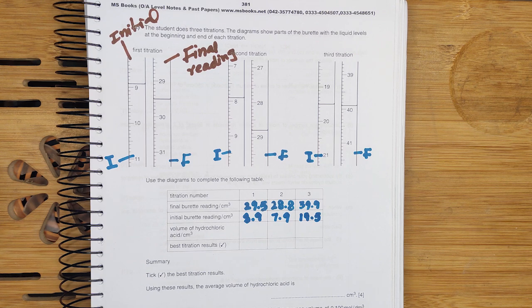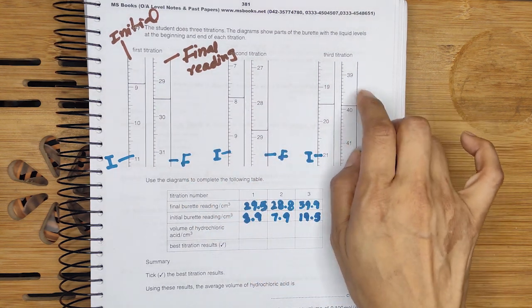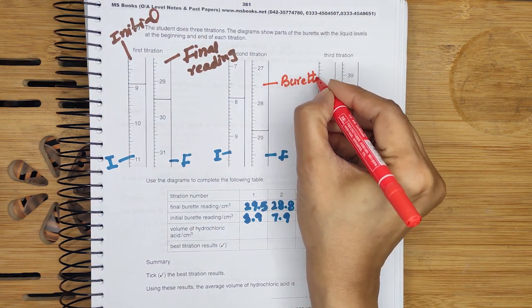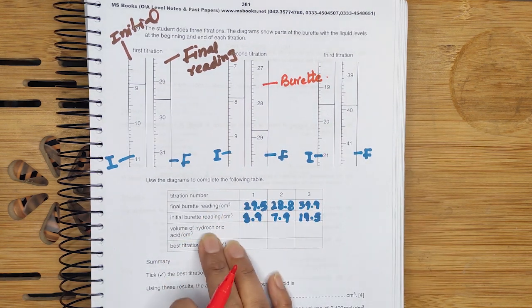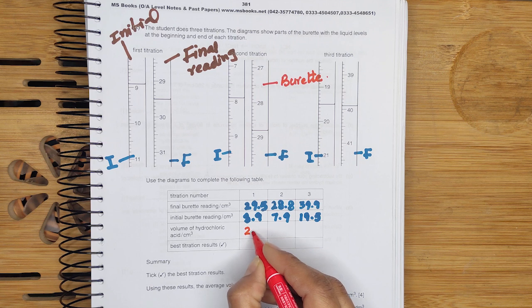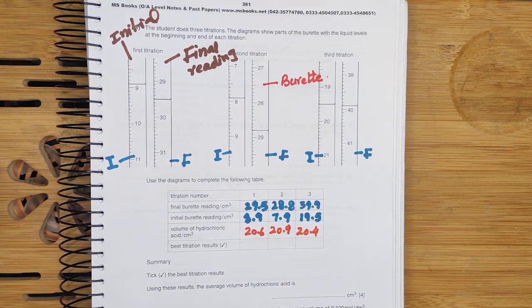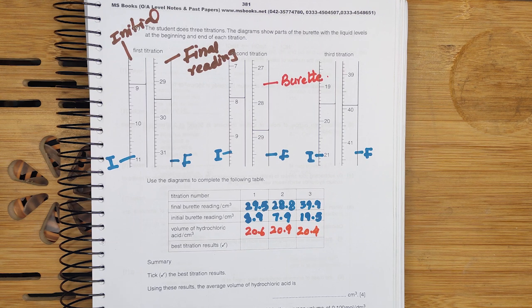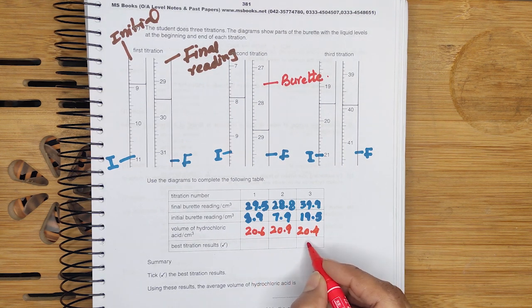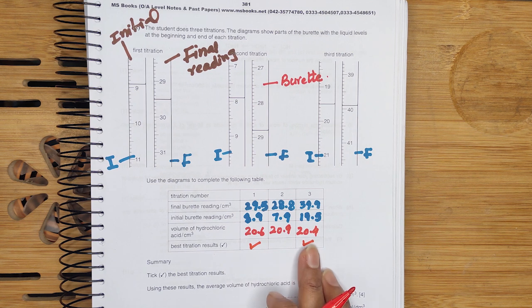These are the final burette readings from the burette apparatus. After writing the final and initial readings, we calculate the volume of hydrochloric acid by subtracting: giving us 20.6, 20.9, and 20.4. The best titration results always have a difference of about 0.2 cm³. The closest difference between 20.6 and 20.4 is 0.2, so we tick these two as the best results — 20.6 and 20.4.